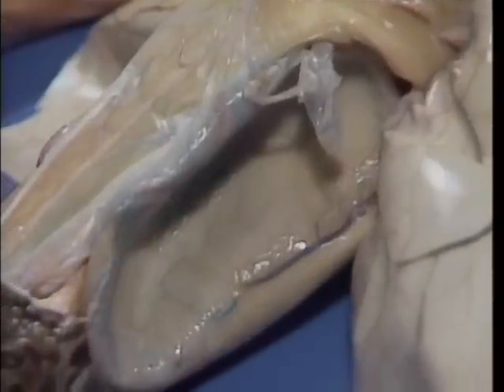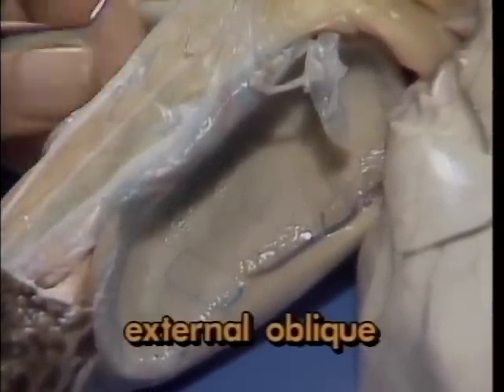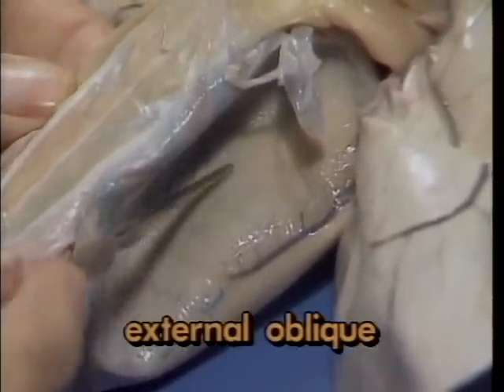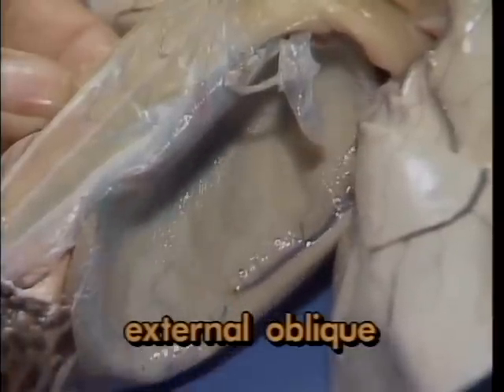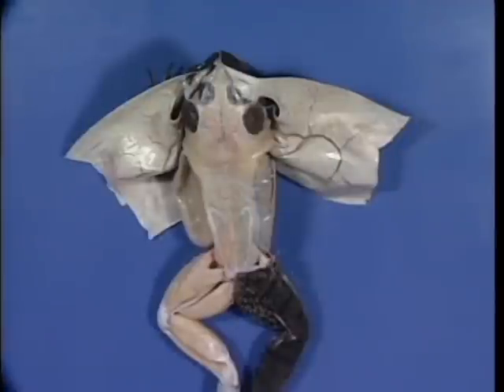Lateral and posterior to these is a broad sheet of muscle called the external oblique, which descends to the ventral side to contain and protect the organs of the abdominal region. Now that we have examined the musculature, let's review some of our general findings before we go on to consider the internal organ systems.